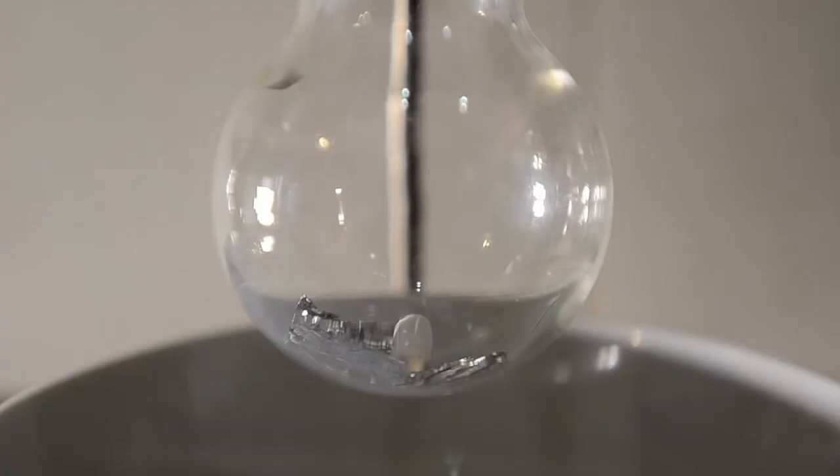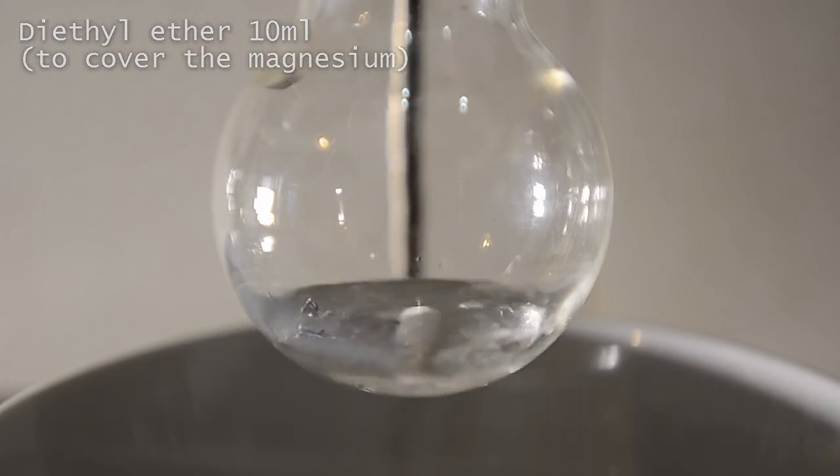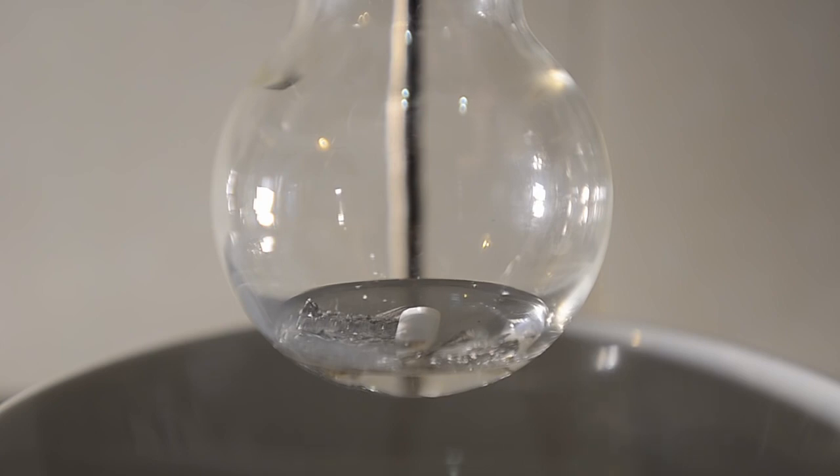We then covered them with 10 ml of diethyl ether, which was straight out of a new reagent bottle. Again, we didn't dry this in any way.